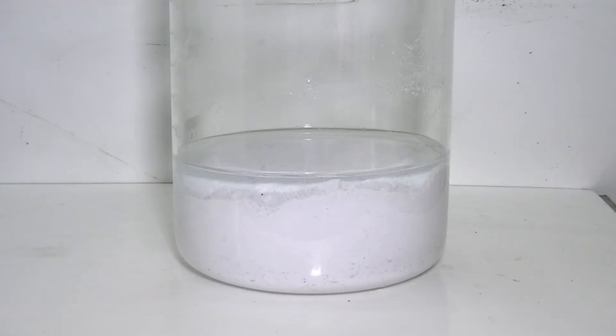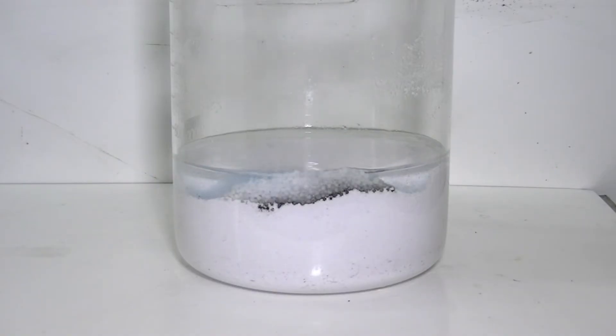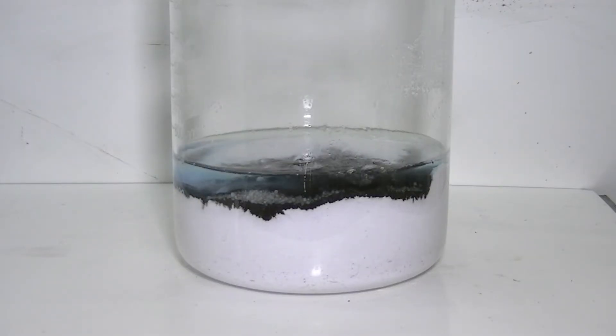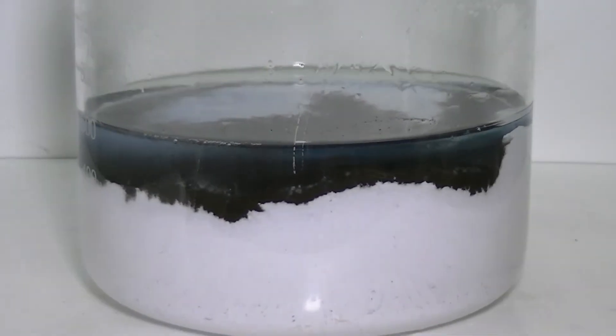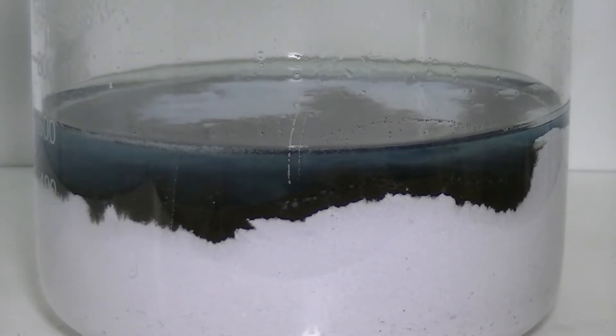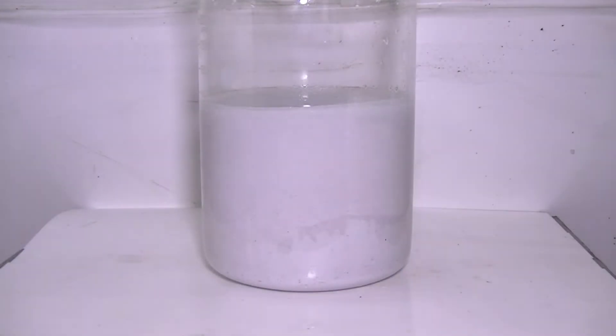Now that the wash water is clean enough, the next step is to convert the silver chloride to silver oxide by using sodium hydroxide. To clearly demonstrate the reaction, I'm adding sodium hydroxide to the silver chloride sludge. The reaction is relatively fast and vigorous, and you can see the dark silver oxide powder in contrast to the pure white silver chloride. The sludge is covered with water and stirred, and the calculated amount of sodium hydroxide is added slowly to make sure all of the silver chloride will be converted to silver oxide. This mix needs to be violently stirred for at least 20 minutes.